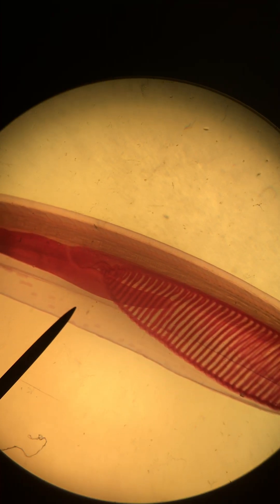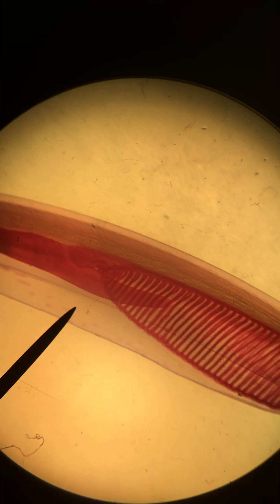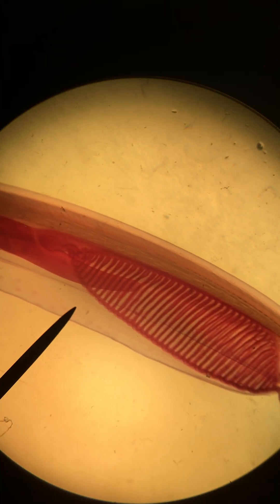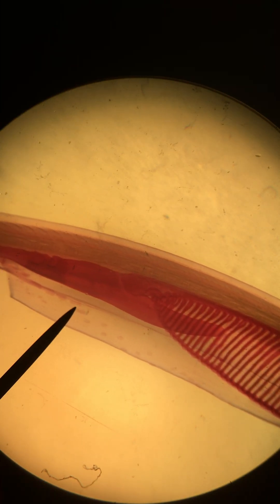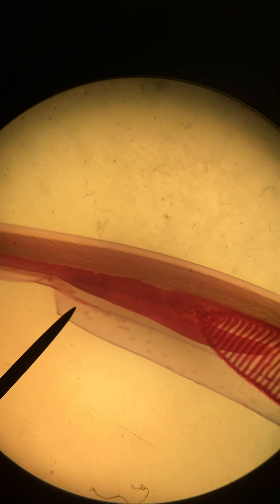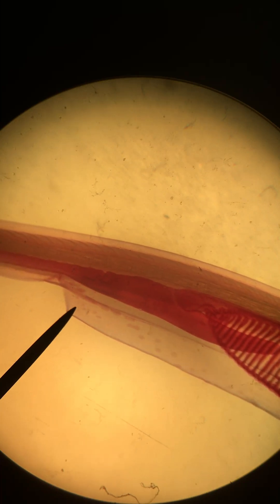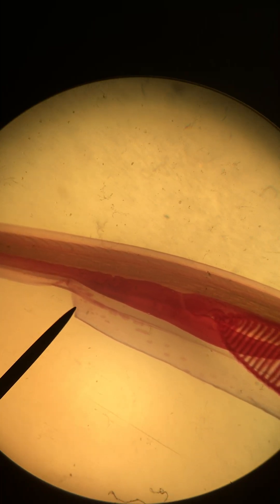Just ventral to that is the atrium, where water will pass through the organism and exit out the atrial pore, which is right here.